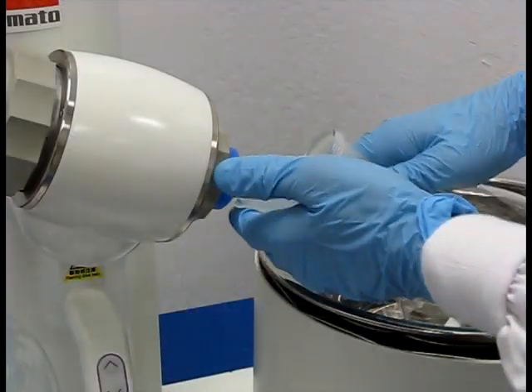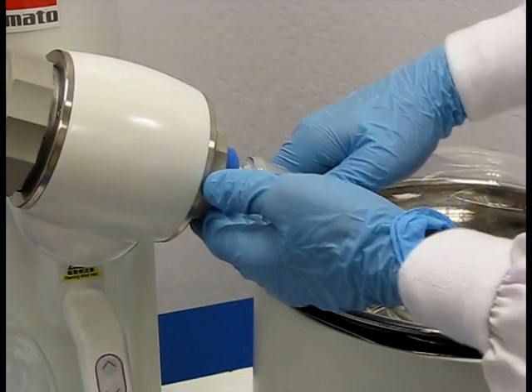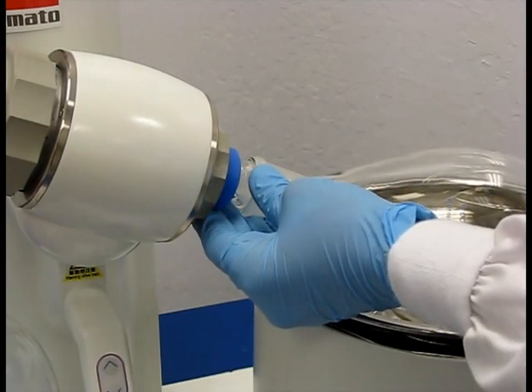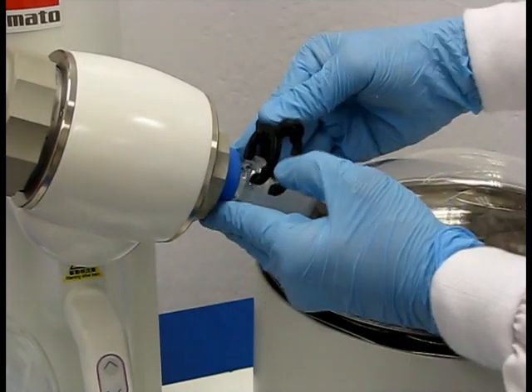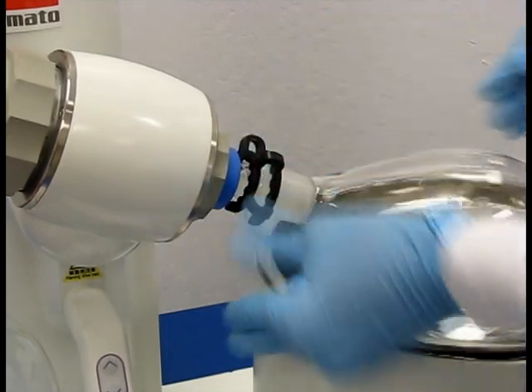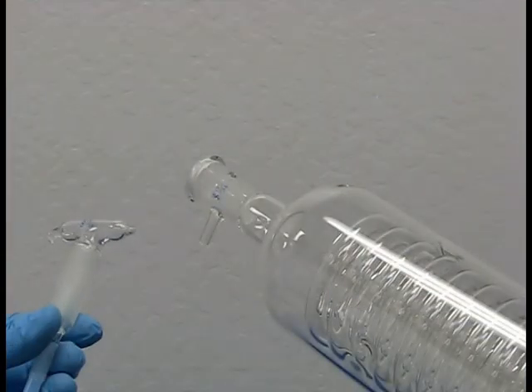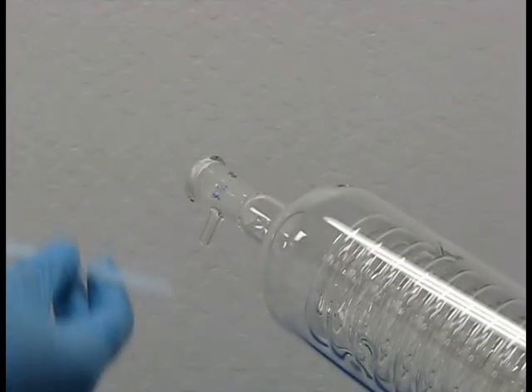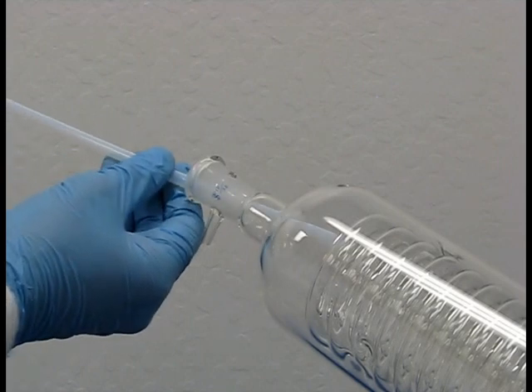Use the evaporating flask clamp to carefully attach the evaporating flask to the end of the rotary joint. Insert the sample induction cock and feed tube through the opposite end of the condenser.